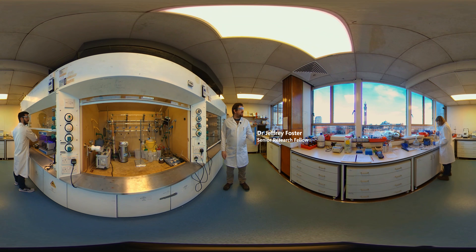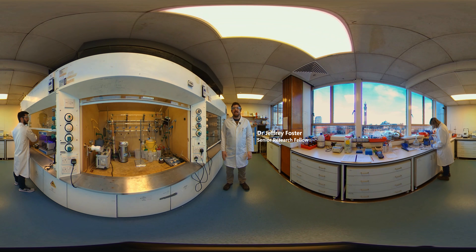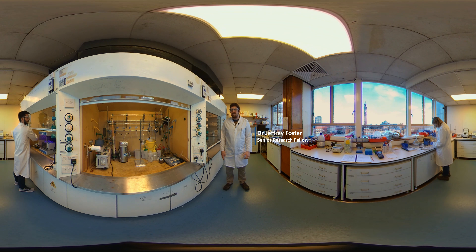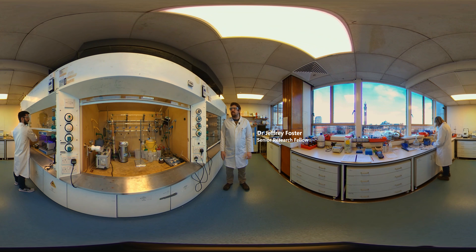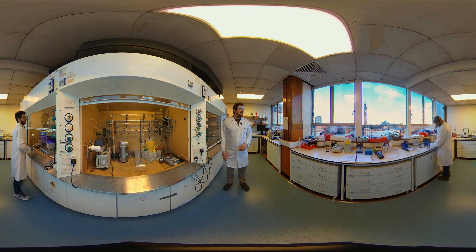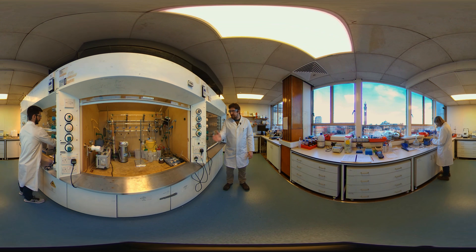Hello. I'm at the University of Birmingham in the Haworth Chemistry Building in Professor Rachel O'Reilly's labs. Here we do polymer synthesis, and you can see around you some of the kit that we use to do polymer synthesis.